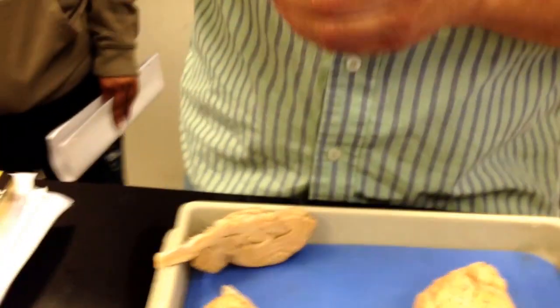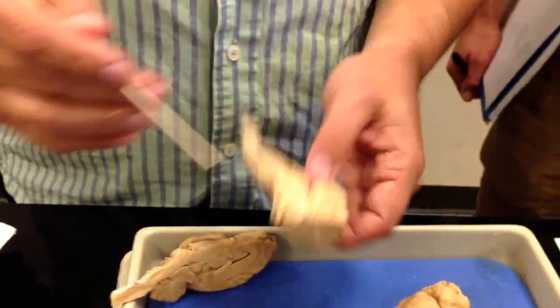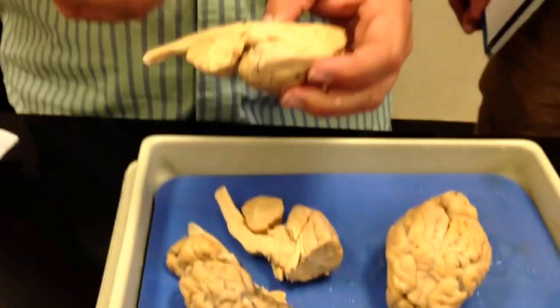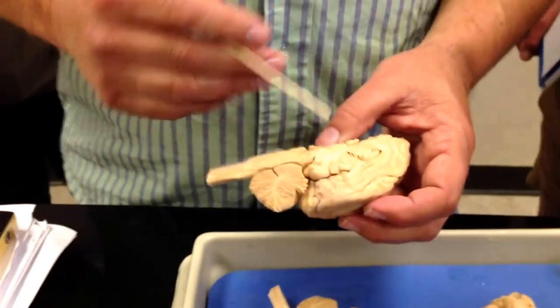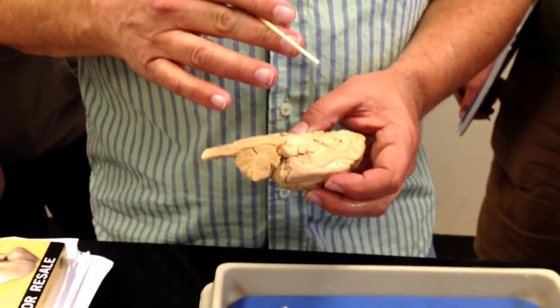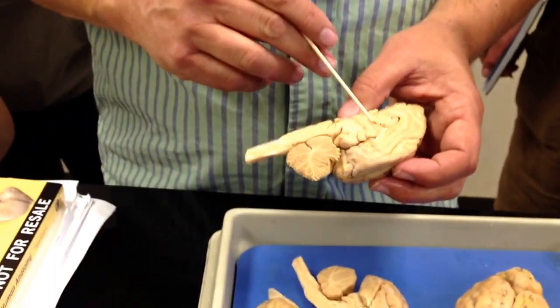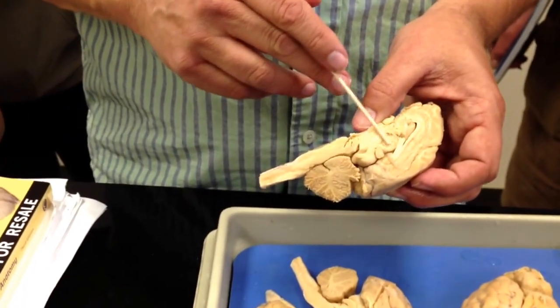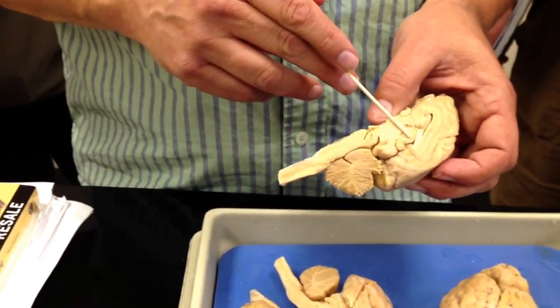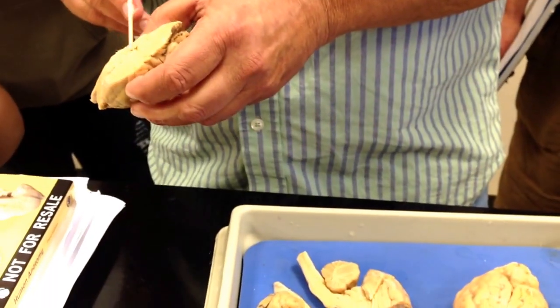And then the third ventricle. The third ventricle lies over the thalamus. Remember that the third ventricle is real thin, so you don't really see it as a discrete structure. It's between the two halves of the thalamus, so it would be right over this. If you know that's the thalamus, then the space over it is the third ventricle.